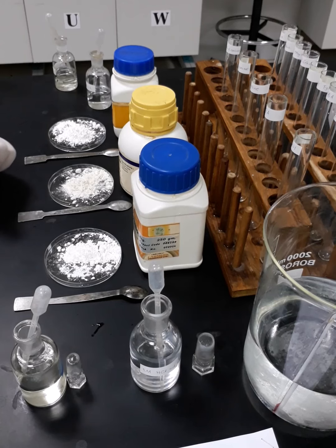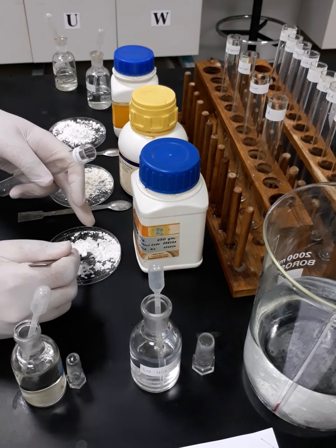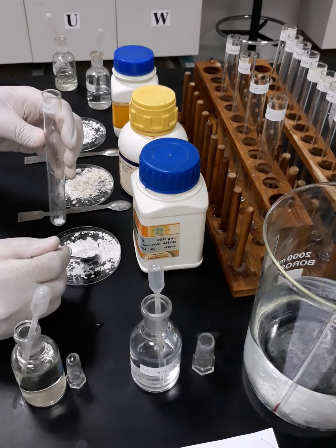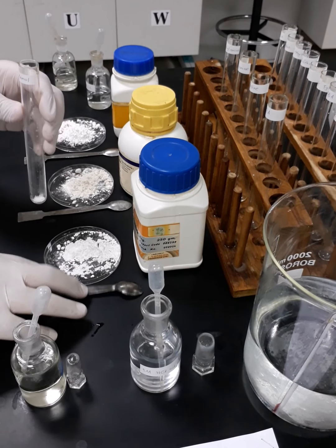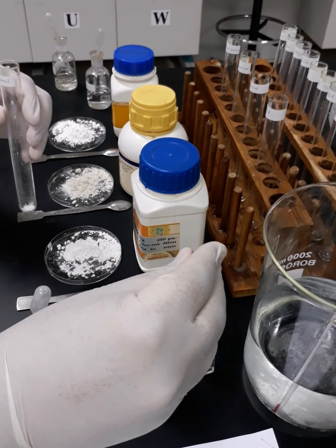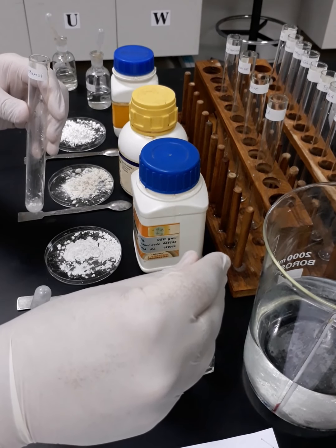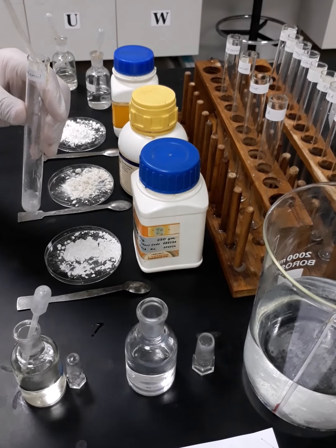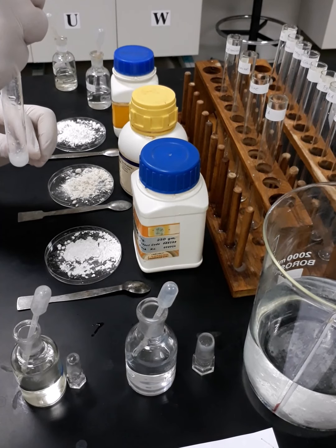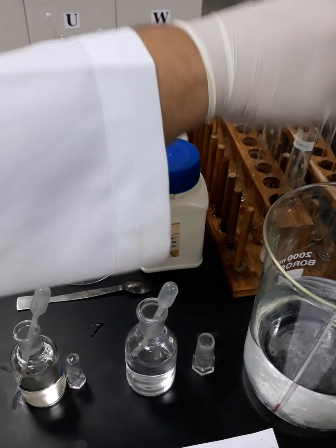Okay, now let's proceed. Here is the test tube labeled as paracetamol. I'm going to take roughly 0.25 gram. Then I'm going to add to that 2 ml of HCl solution. So this is the first ml. Then the second ml. Gentle shaking to ensure that this non-dissolved particle will not go up. Okay, so now we are done with paracetamol.